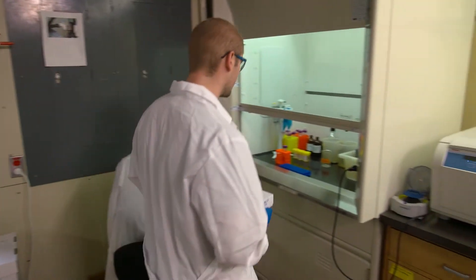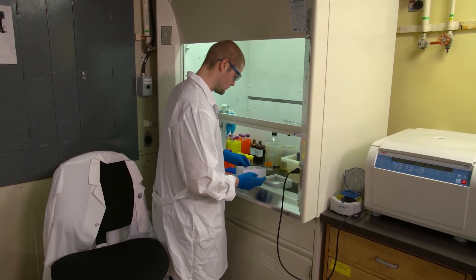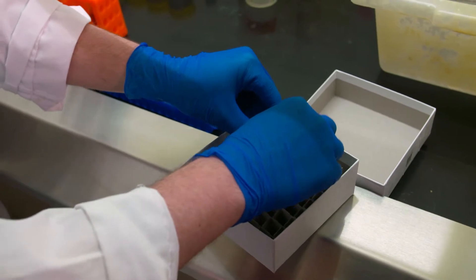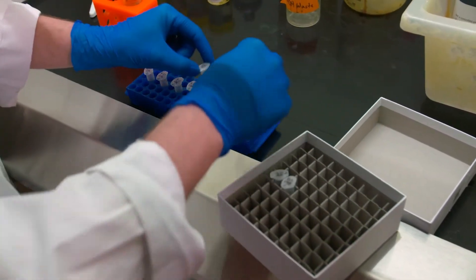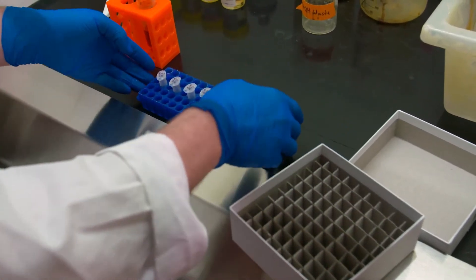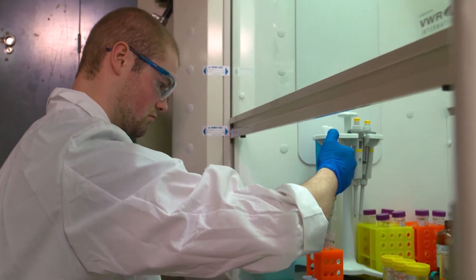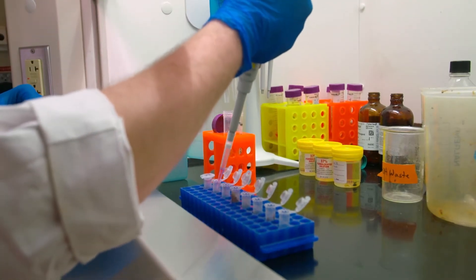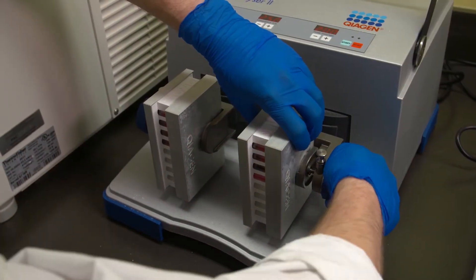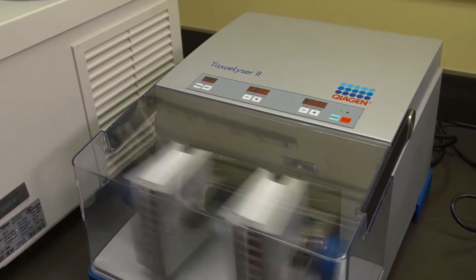The kidney sample from our fish necropsy is being processed and prepared for RNA extraction. Because viruses are made up of RNA, all RNA needs to be removed from the tissue samples to prepare them for RT qPCR testing. A solution is added to the tissue along with microbeads to help break down the tissue. Vials are placed in a tray then into a machine called a tissue lyser and shaken until they're pulverized.